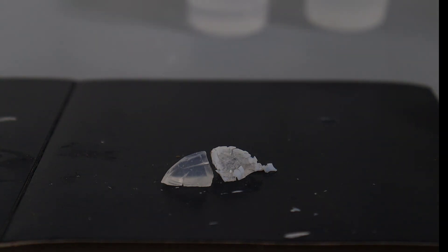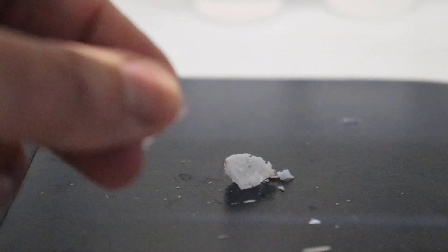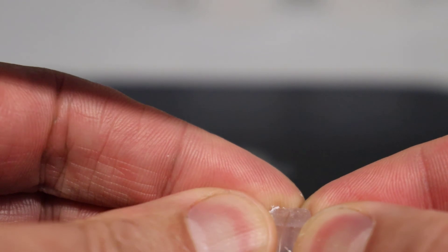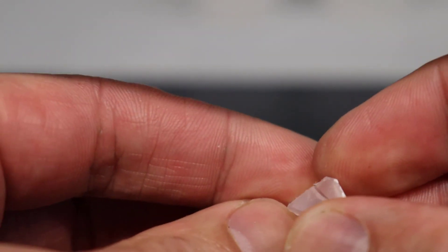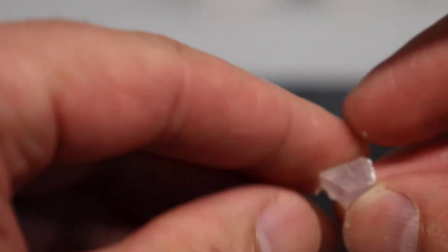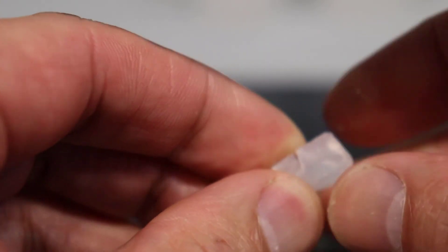Which is why I put the other part back in the container and put the lid on. Enough will leak out through the closed lid so that it will dry very slowly on its own, and that will probably save this one because the pores aren't that small. Now you can see — there's a big crack in there and it goes pretty much all the way through. It's cracked almost all the way through from the internal stress generated by the liquid evaporating.